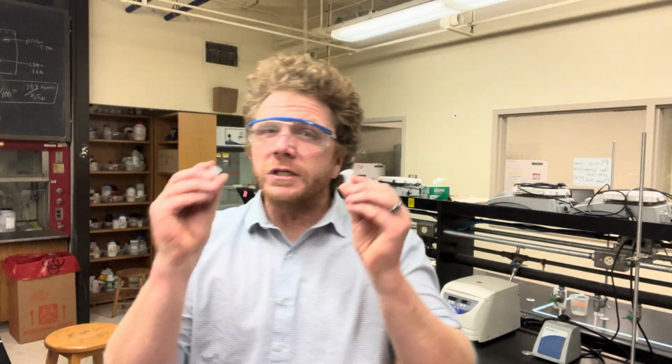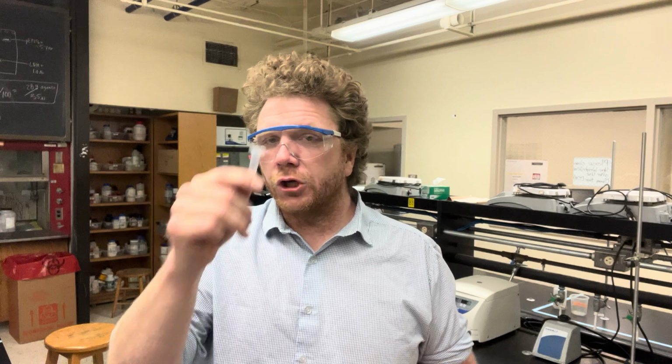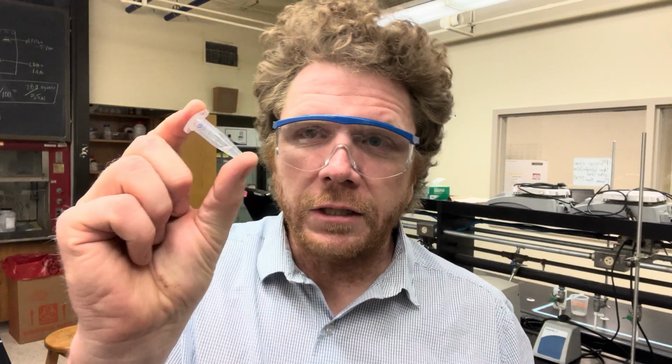So what do you do in that case? What you do is you make a dilution. So the dilutions that I just made, those were of my known protein being pancreatin. I know approximately what the concentration of this dilution 1 is because it's 1 part stock, which is 10 micrograms per microliter, and 1 part deionized water. And those are equal parts. So, spoiler alert, dilution number 1's concentration is approximately 5 micrograms per microliter.